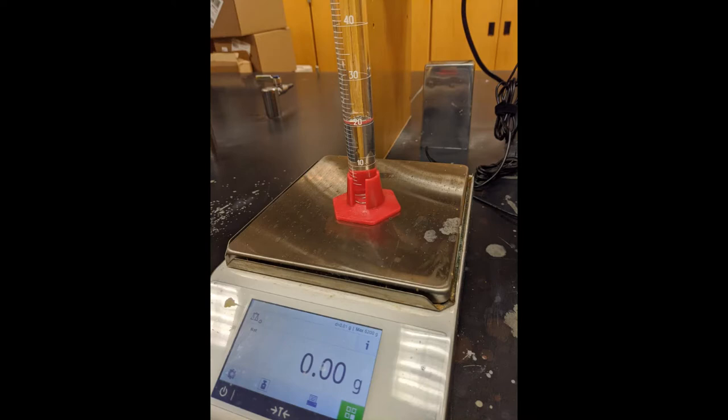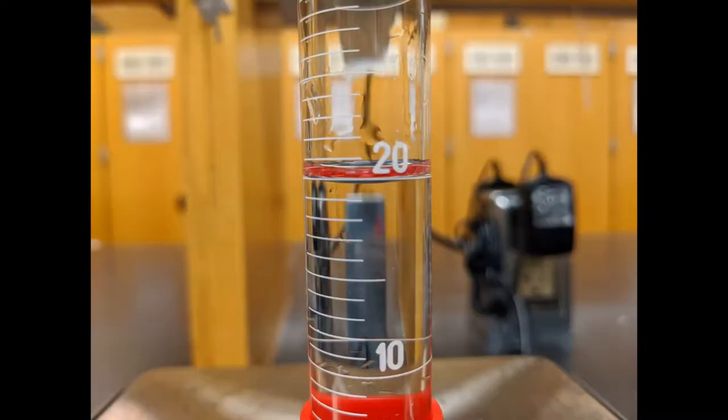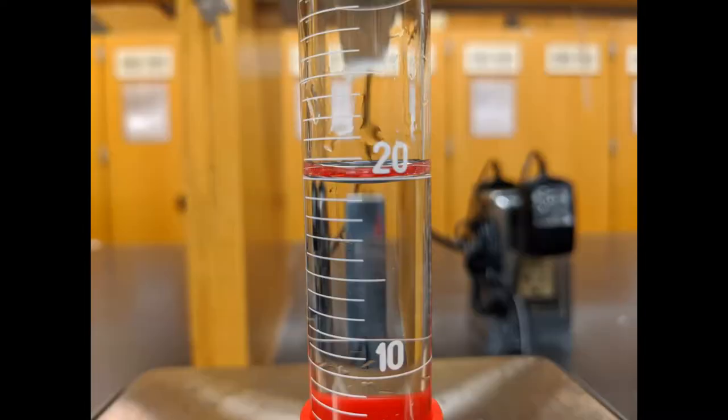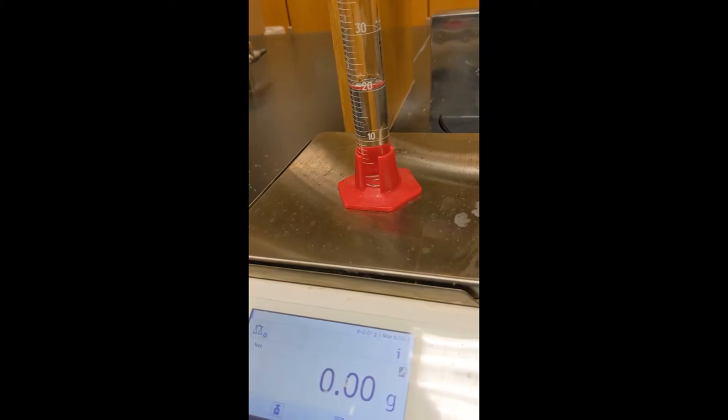So we have a scale, we have a graduated cylinder with some water in it, right on the line at 20.0.